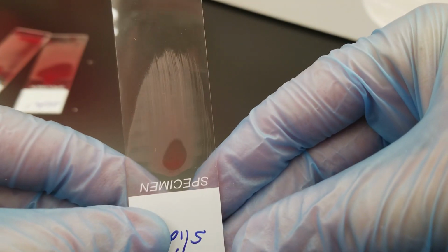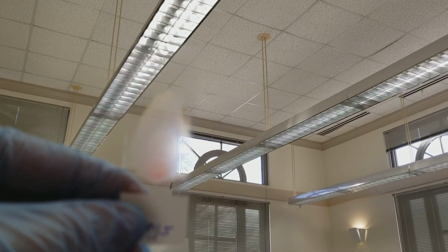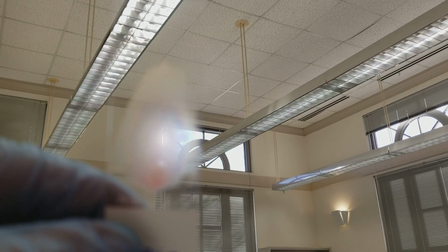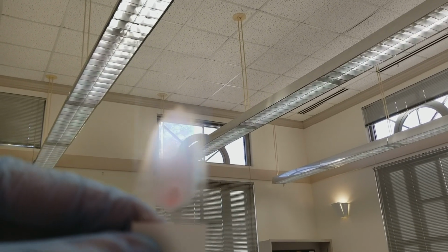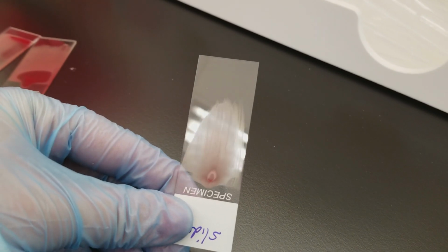Okay, let's see. This one's drying. No, you can't really see a good sheen on there. If you have a good one, see that sheen? It's trying to focus on the window instead. There's a sheen that goes around. See how, come on, focus camera. See how there's that kind of halo around that thicker area, but it gives like a sheen. That's where your feathered edge is going to be. I'm so sorry this isn't working so well. I don't think I can really show you, but there is a sheen that goes around the thicker area to give you that feathered edge look.